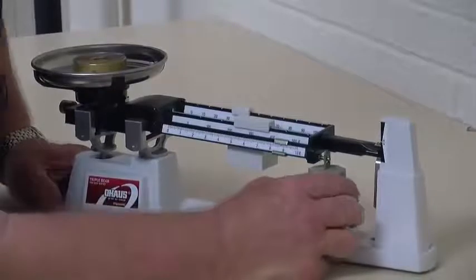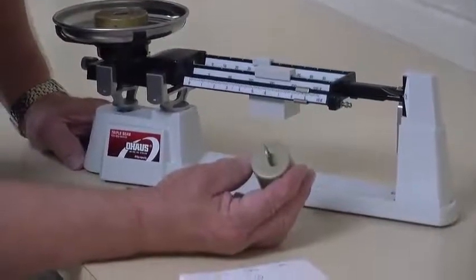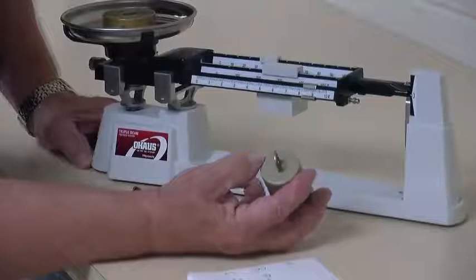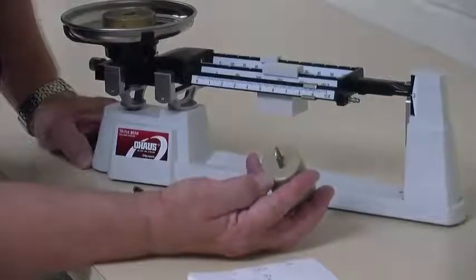Now, if you have to do that, you may be confused by the two numbers here on the weight. One says one kilogram, the other one says 295 grams actual.